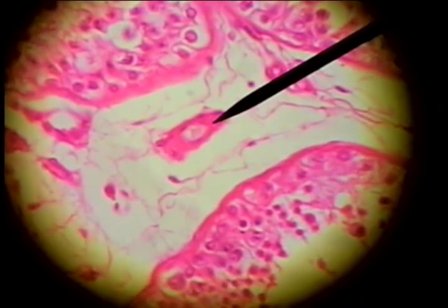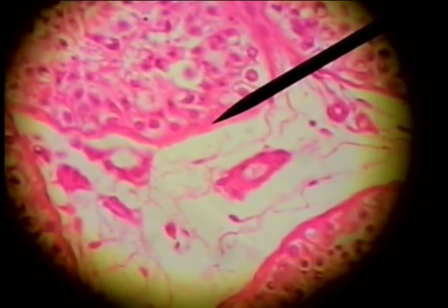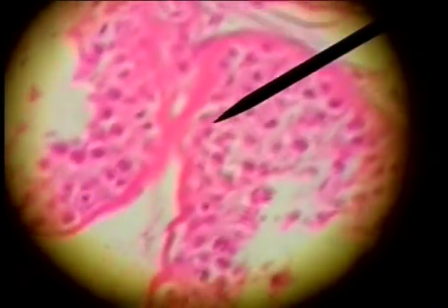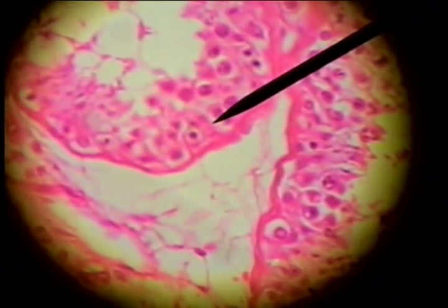And then if we go to the wall, here's the capsular wall of a tubule. We'll find one with a lumen here, and here's one with a lumen.